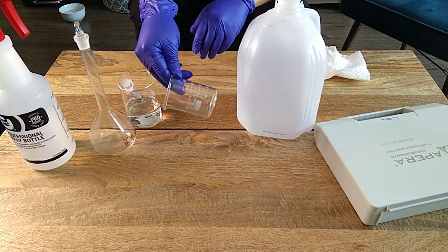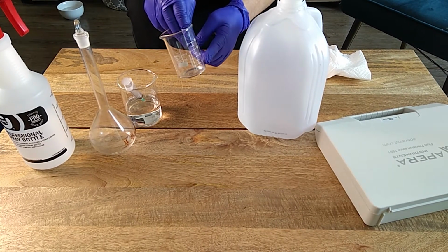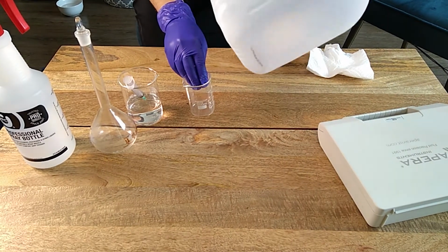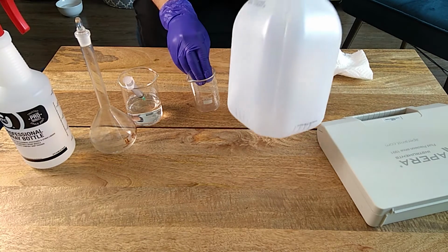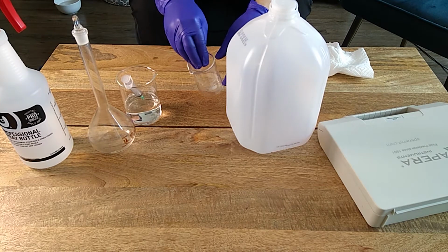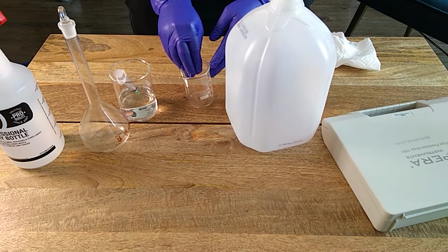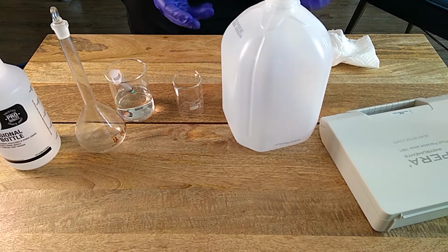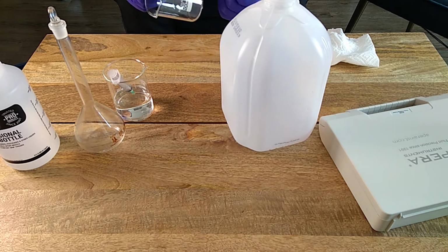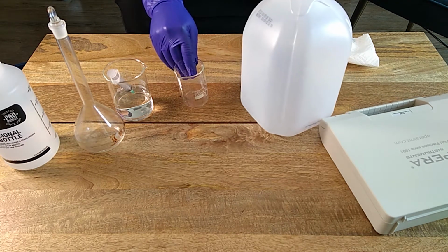The same thing goes for these. Just because it says 20 here, it doesn't mean that those are 20 milliliters. This is not calibrated volumetric material. And the tank that you use at your crop is not calibrated volumetric material. So how do you know that you're filling it up to a certain volume? Well, you do not know. This is the reason why many of these solutions are often inaccurate, and they can be inaccurate by a lot, by 10, 15, 20%. That means you're preparing your nutrients inaccurately.